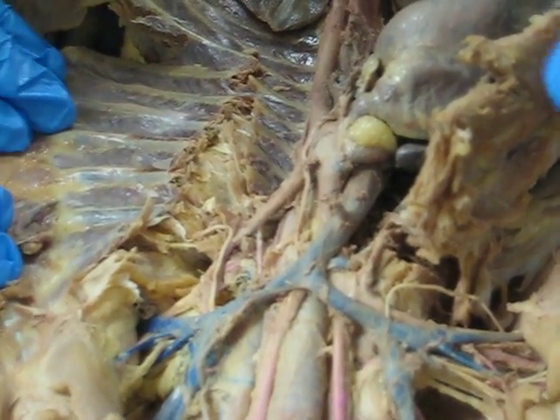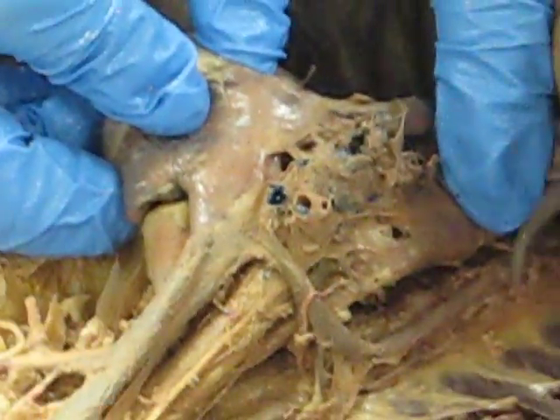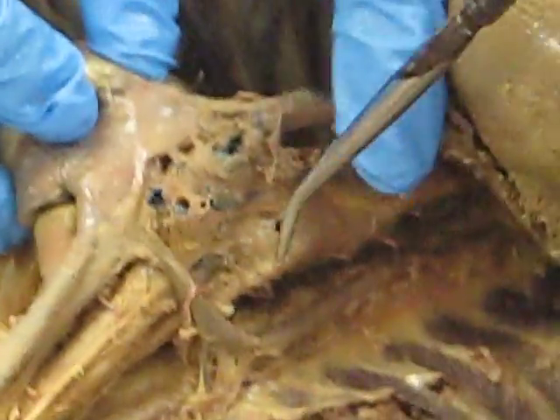With the internal thoracic artery coming off right here. We'll flip over the heart to see the azygos, which is right here — it runs all the way through and down through here.